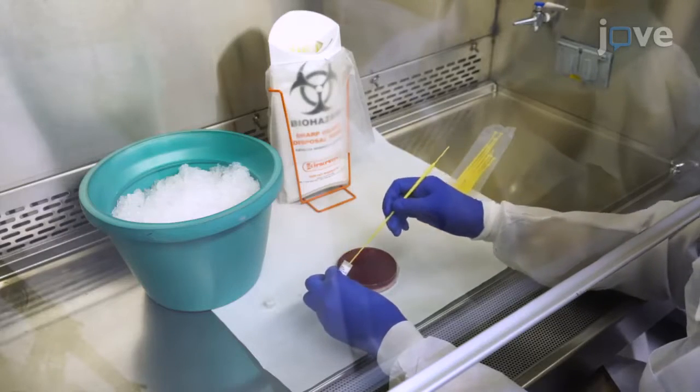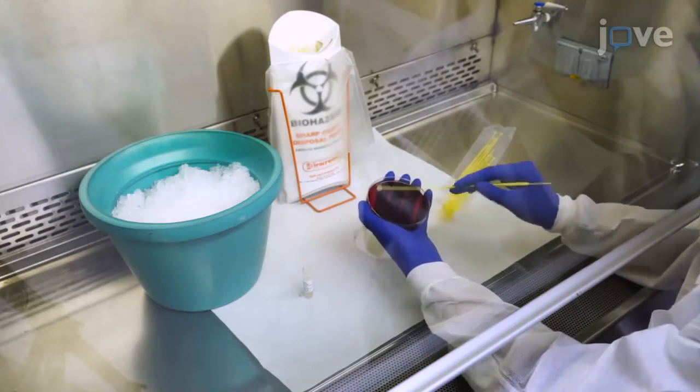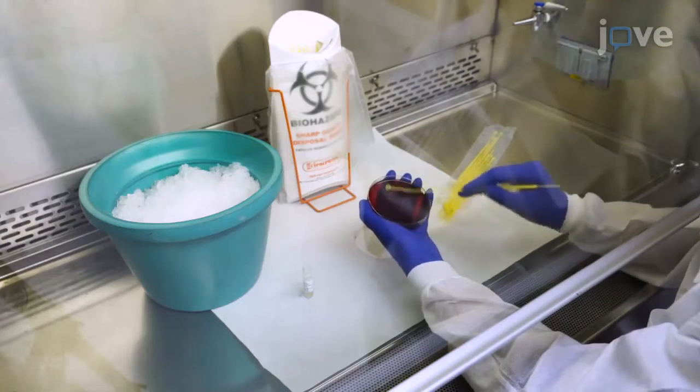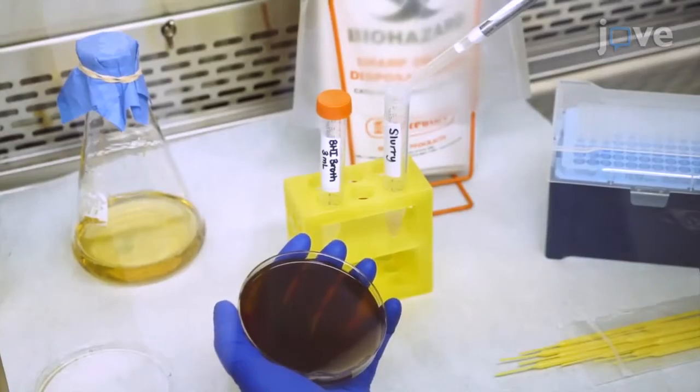This technique allows clinically relevant patient symptoms to be correlated with a positive fecal culture result and, for the first time, an actual number of bacteria.